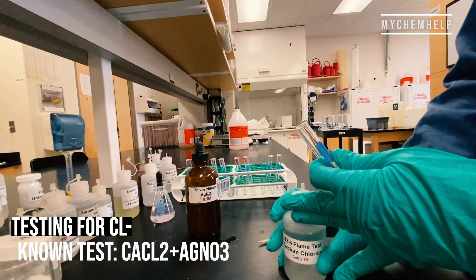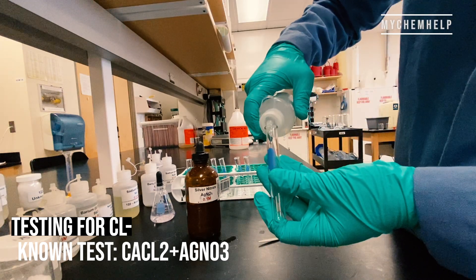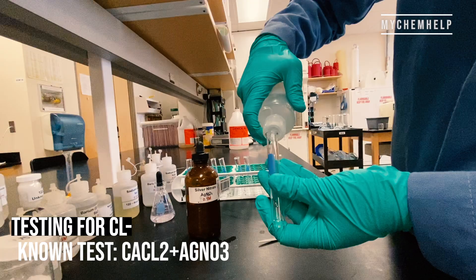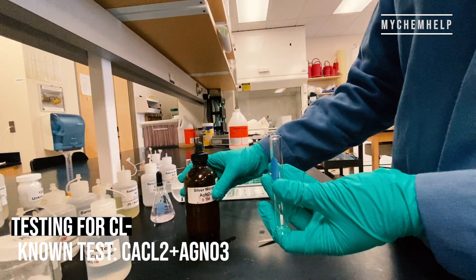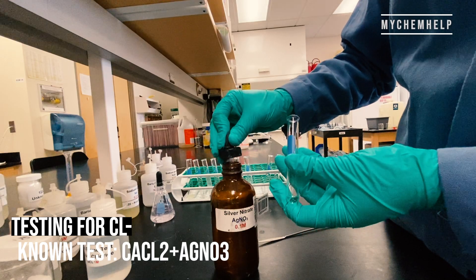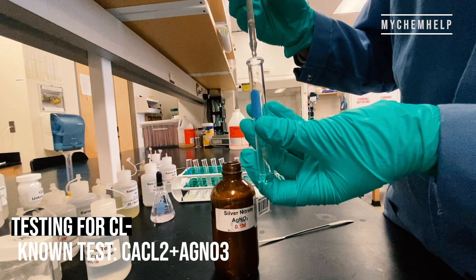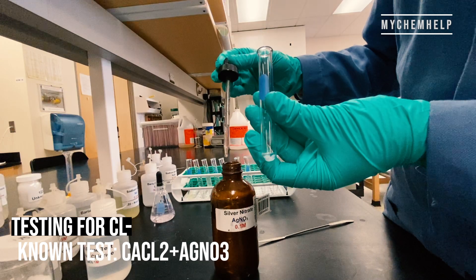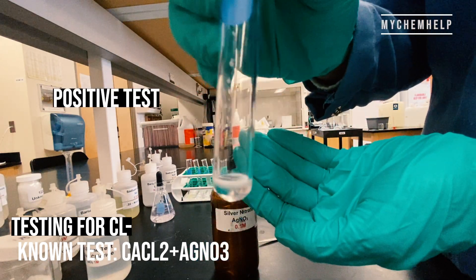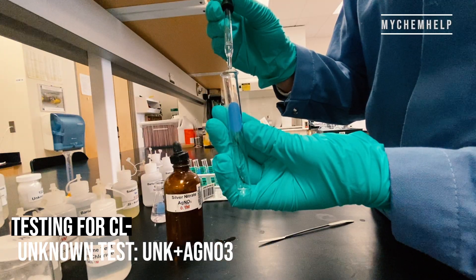Next I'm testing for the chloride ion, Cl⁻. I've got calcium chloride going right into the tube with some silver nitrate — that white precipitate means it's a positive test. And here goes our unknown.